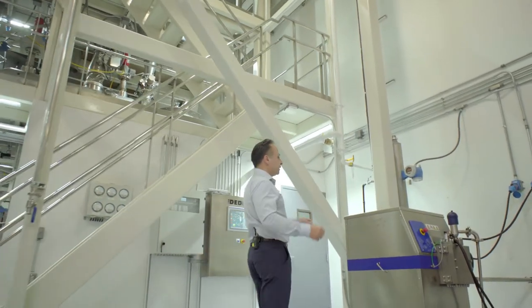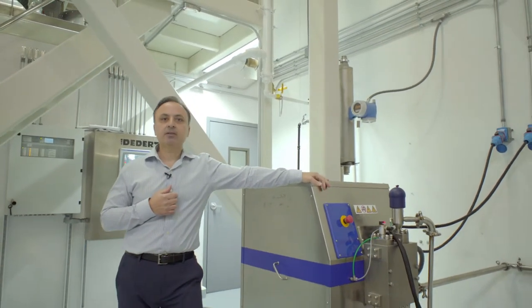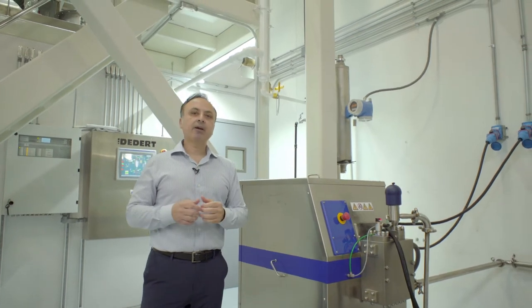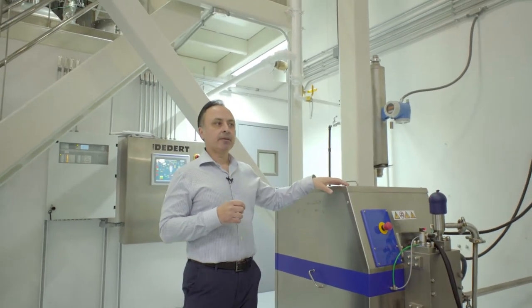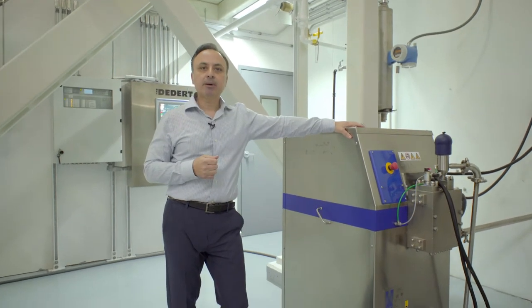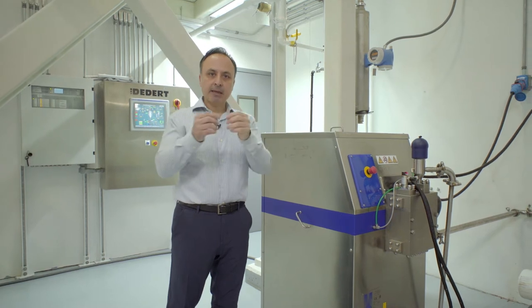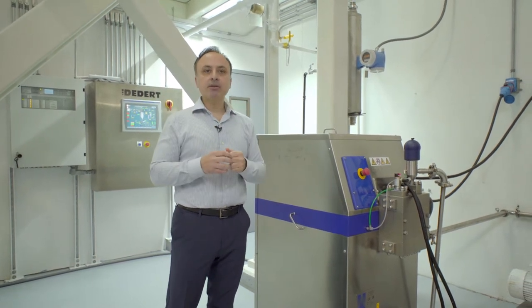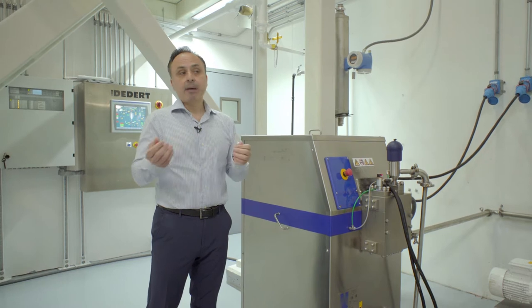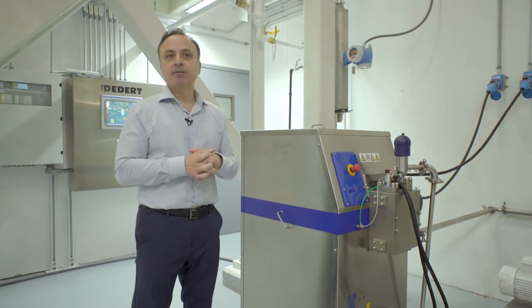This spray dryer was installed in 2017, so it's about three to four years old, and it's a state-of-the-art system. The spray dryer, unlike a ring dryer which takes a cake or paste, functions to take a liquid, atomize it into light discrete droplet particles, and produce a fine powder or agglomerated products. This pilot plant is very multifunctional.